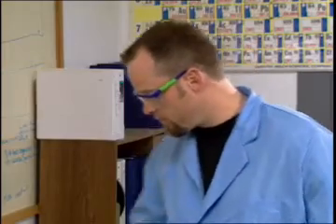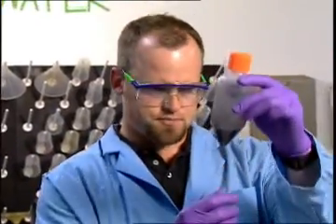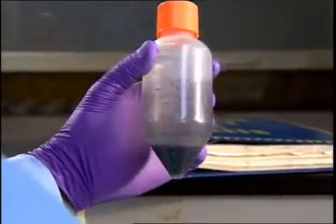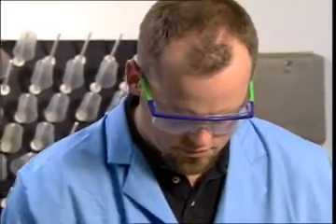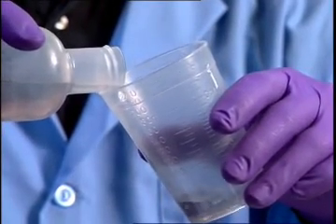George knows he's not finished with this procedure just yet. That black goo in the bottom of a centrifuge tube, that's residue from the test, a mixture of reagents, solvents, and reaction products. It's just a waste with no further value, but at the same time, it's a serious responsibility for George and for the lab, because that residue is a hazardous waste.